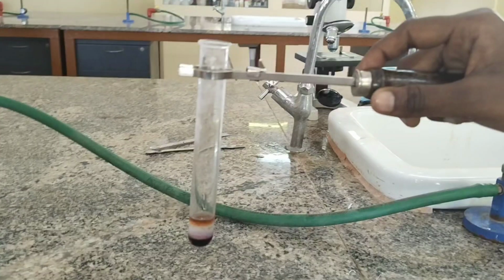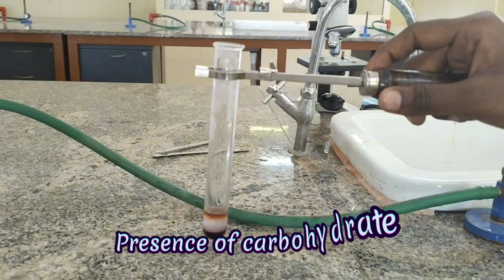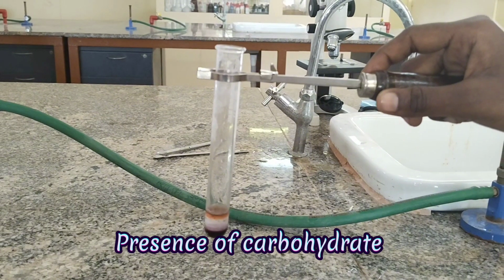Observation: a violet color ring is formed at the junction of the two liquids. Inference: presence of carbohydrate.